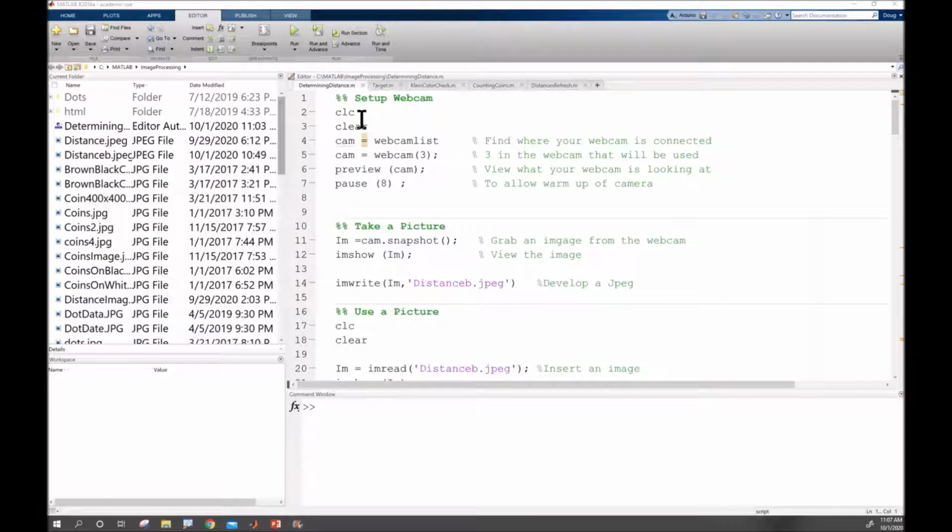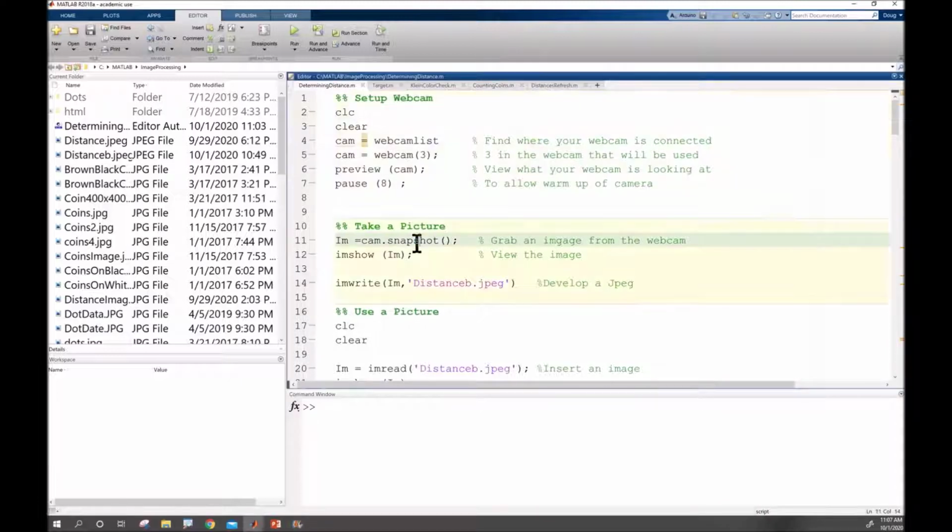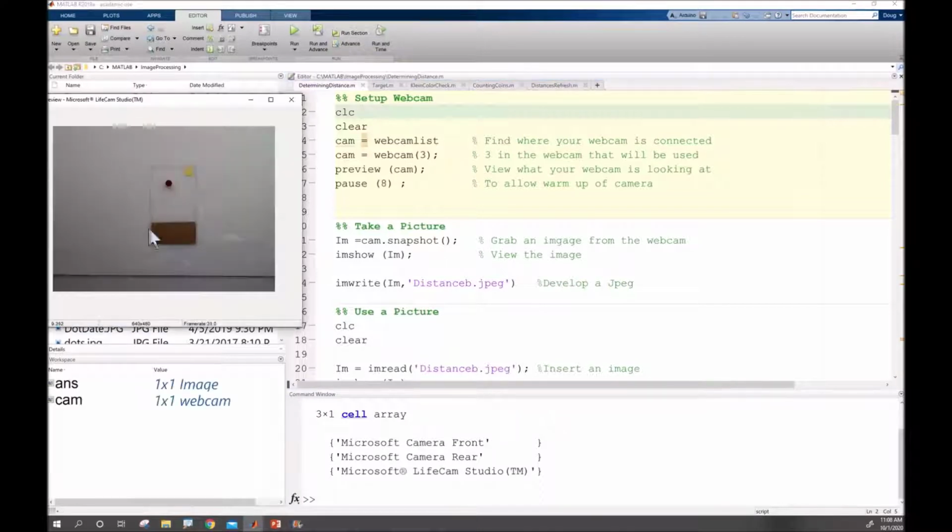What I've got going is I'm going to be working in sections, so you notice as I click through this, that's only highlighting a certain area, and that's going to allow me to run one section at a time. In other words, if I'm going to have to pause for 8 seconds for this camera to warm up, I only want to run that one time so I don't have to worry about it. And so this is actually a real-time view of what's going on in the camera, and you can see that is within Matlab, which is easy to work with.